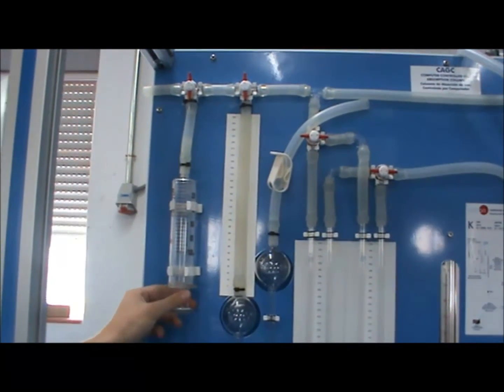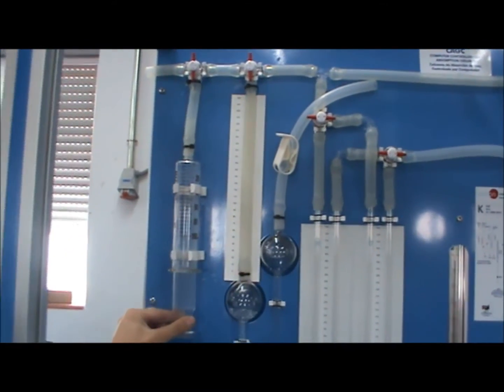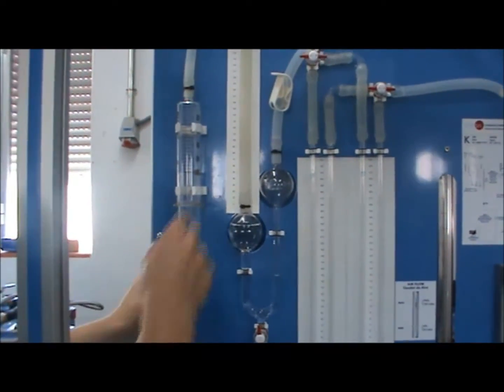Make sure valve V1 is open, and push the plunger downwards, sucking the KOH solution up through the U-shaped vessels.